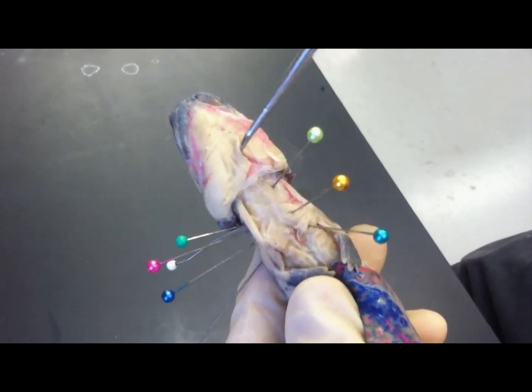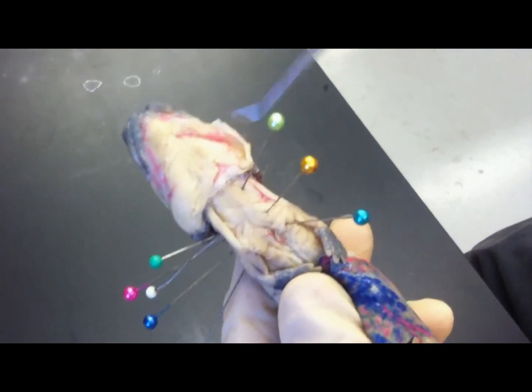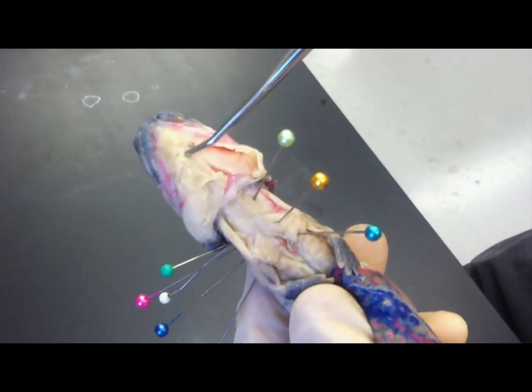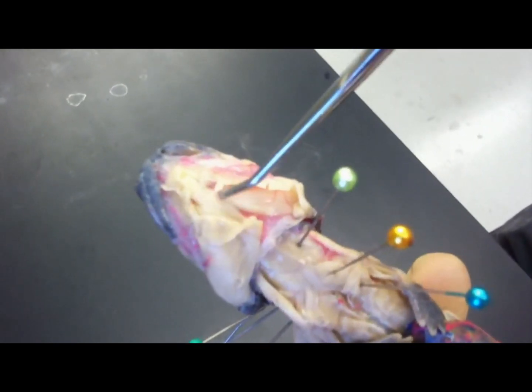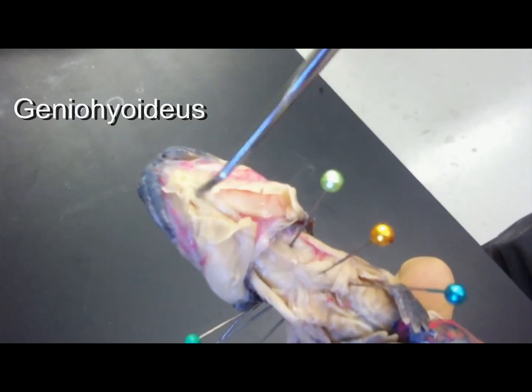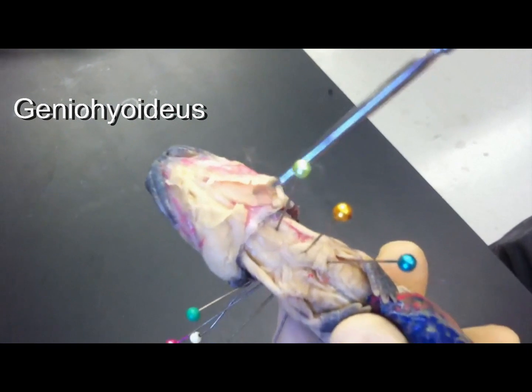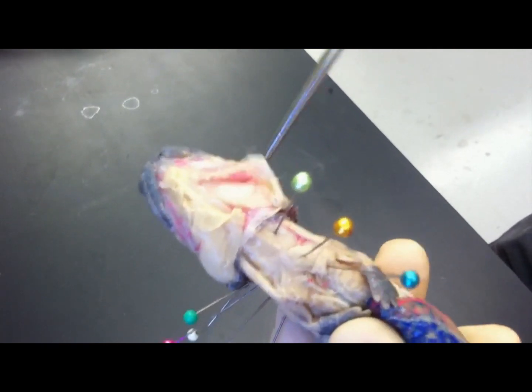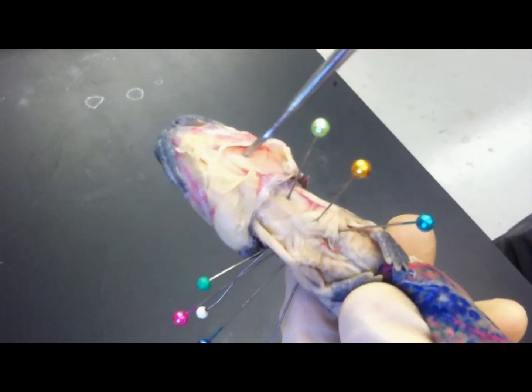Underneath them, when you reflect them, there's a paired muscle right down the middle, the geniohyoideus, and then you can see the branchiohyoideus right there as well.